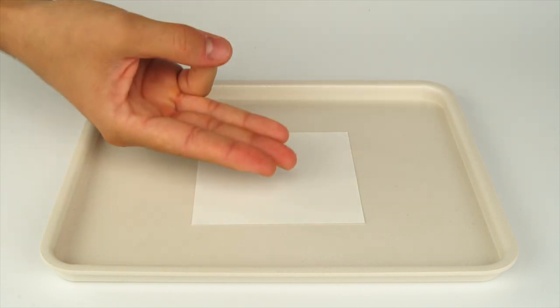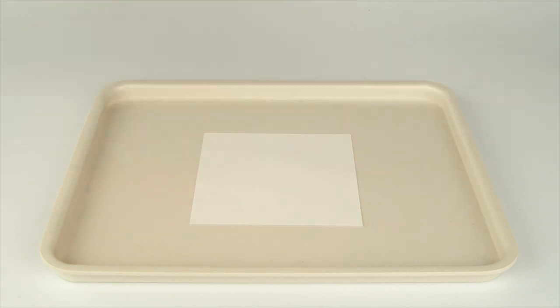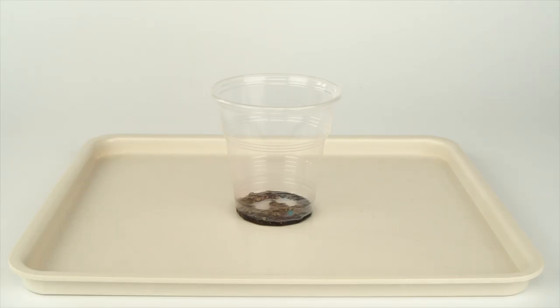Wipe your forehead with three fingers and press these three fingers to the piece of paper. Place the paper on top of the plastic cup, fingerprint side down.